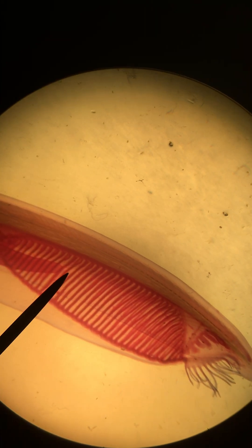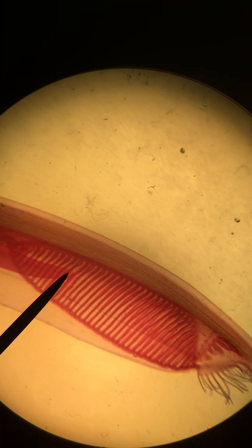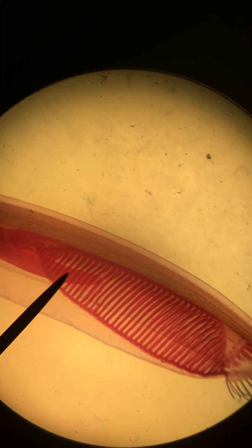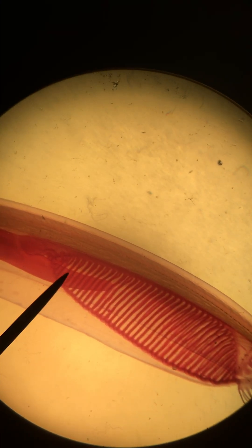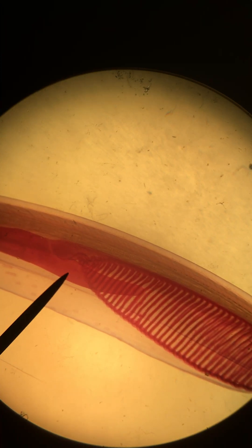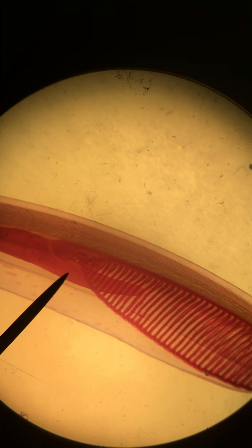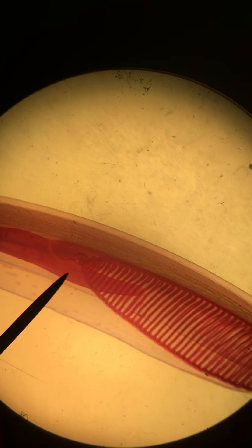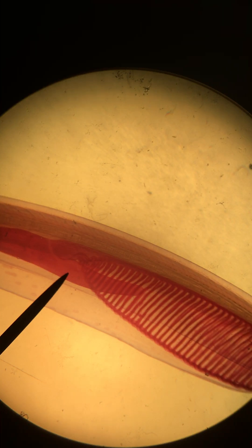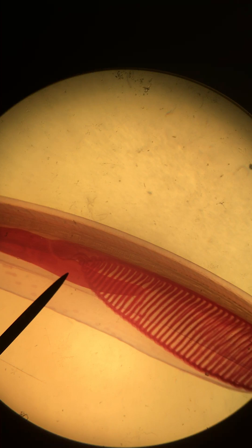If we continue caudally, you can see just behind the gill bars and slits, this is the hepatic cecum. Its functional role is for processing smaller foods and lipids and glycogens especially.